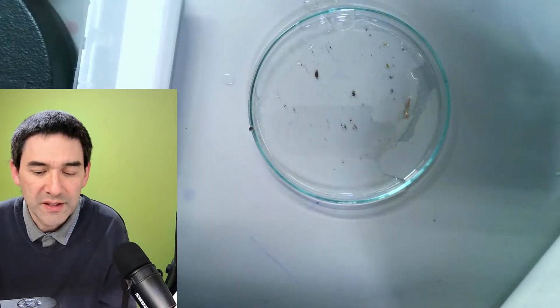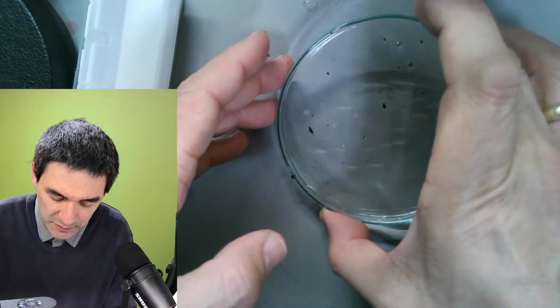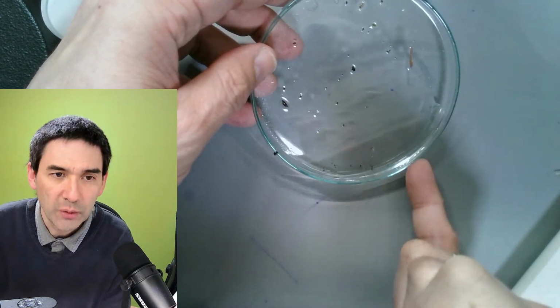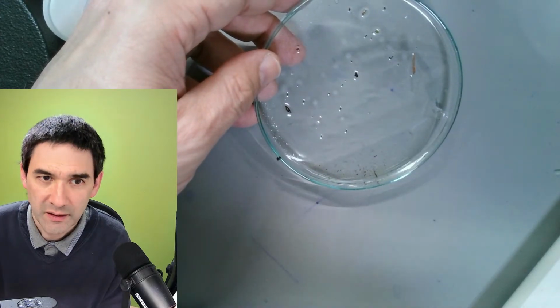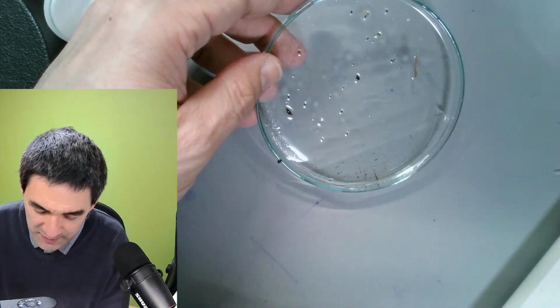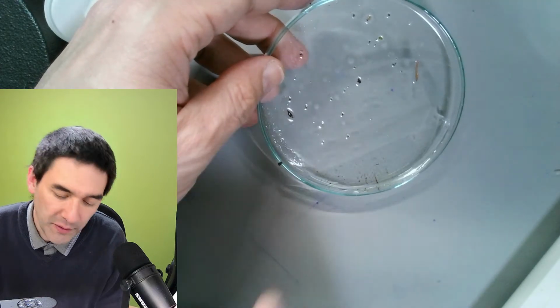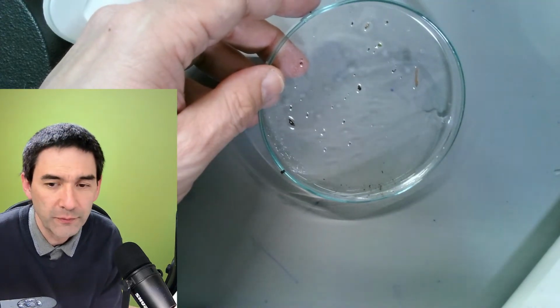You can already see that there are also a lot of particles here. And then you just try to hold it like this. You wait until whatever is in here collects at the bottom, and then you take that. That is kind of the easy or the simple way. It also works, but indeed, I think with the Baerman funnel, I'm seeing a higher density of organisms.